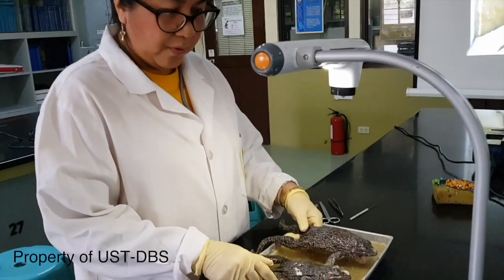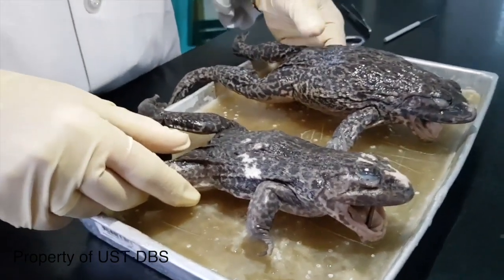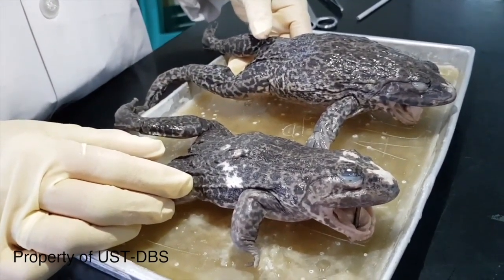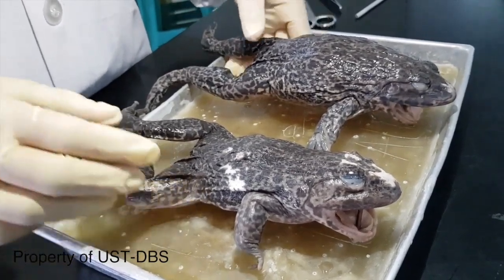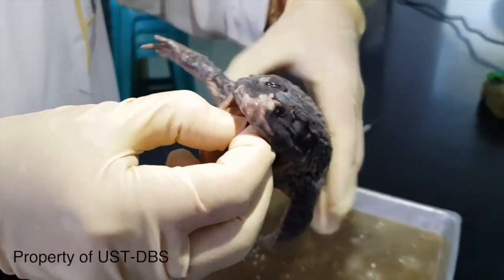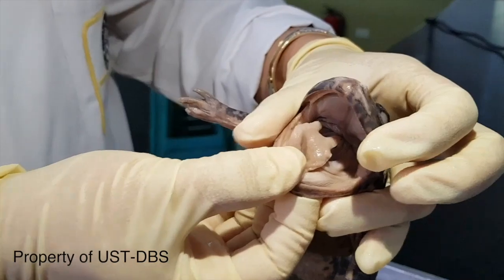Our specimen for dissection and representative for class Amphibia. The species is an introduced frog in the Philippines. Its scientific name is Hoplobatrachus rugulosus, or in some, it's Hoplobatrachus chinensis. So if you're going to look at the anatomy of the frog, let's remove first the stick. It is used to make the mouth of the frog open so we can see some of the structure.